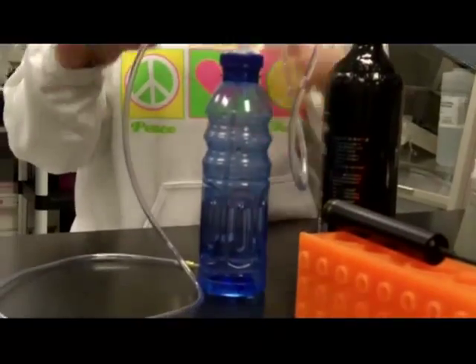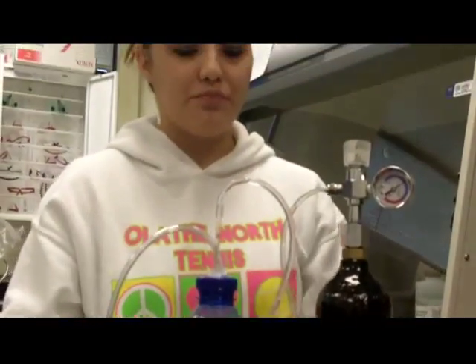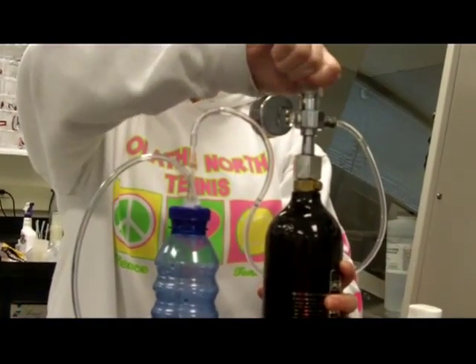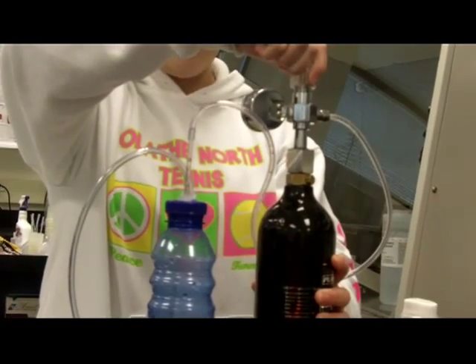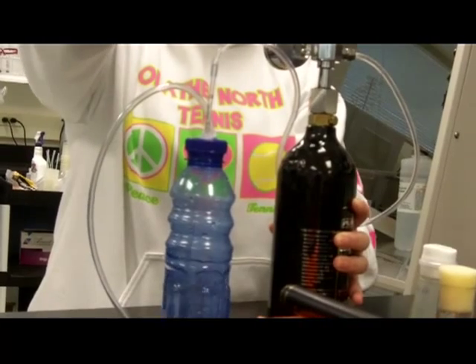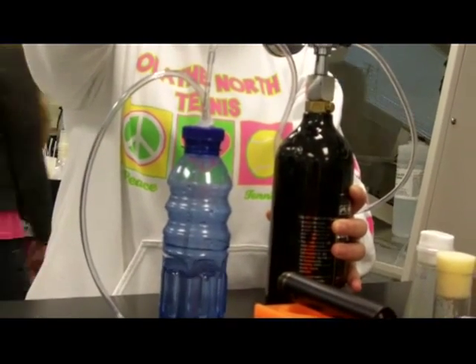Because you don't want it too high — if it's too high, then your flies will blow all over. So you want to turn on your CO2 tank with this little nozzle here, and you can see how fast it's going. You want to keep it relatively low. Right there is good.